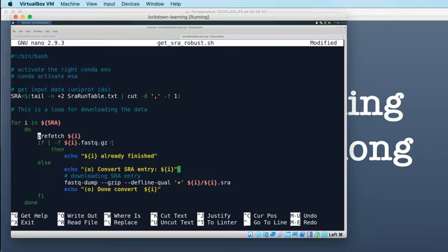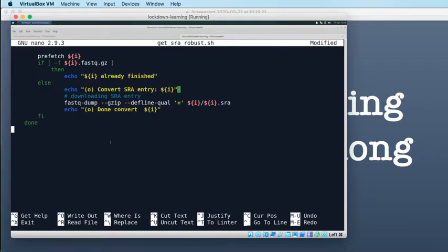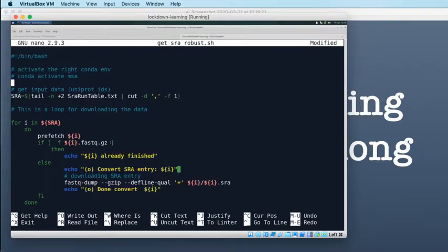Yes, assuming. And if we run this a second time, if Prefetch has worked fine, then it won't run again, and our FastQ files will already exist. So they won't get created again either. So that should be the most robust way of getting this data, I think. I hope that should work relatively straightforwardly.